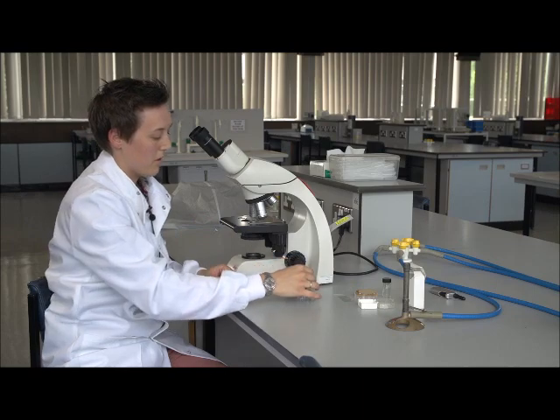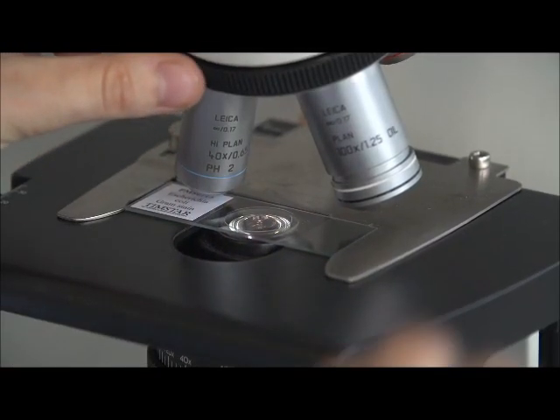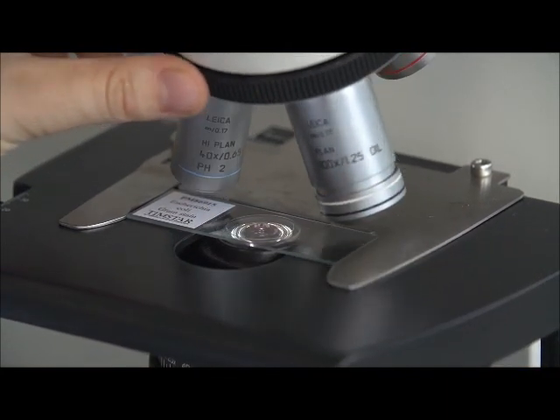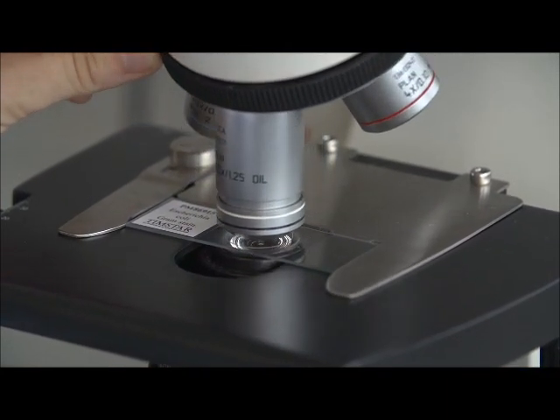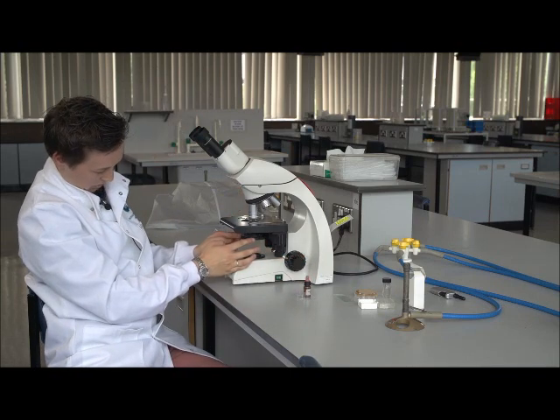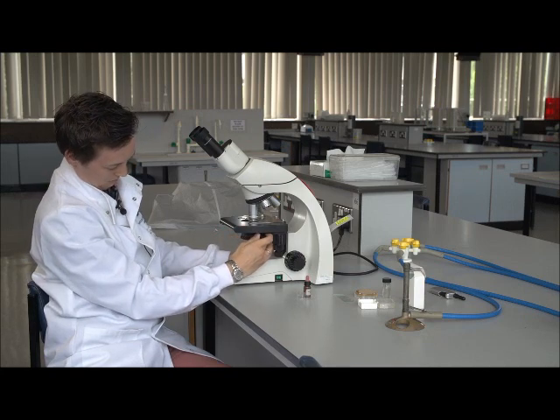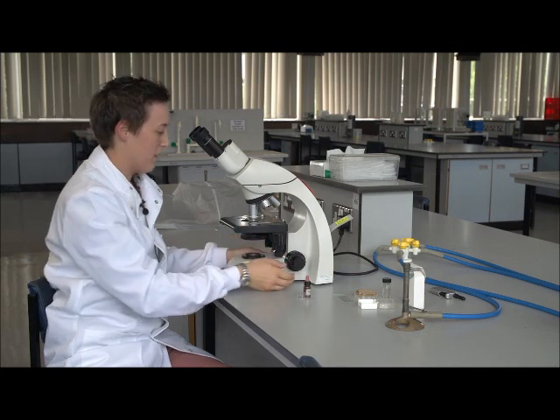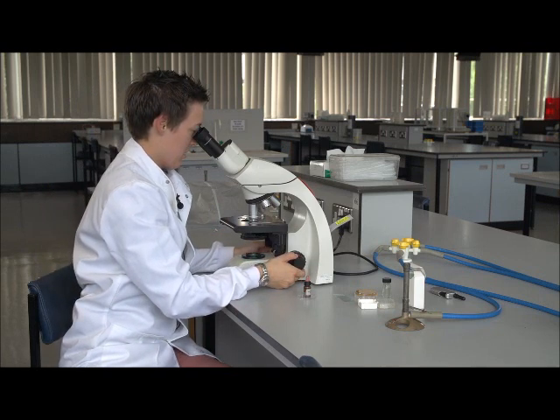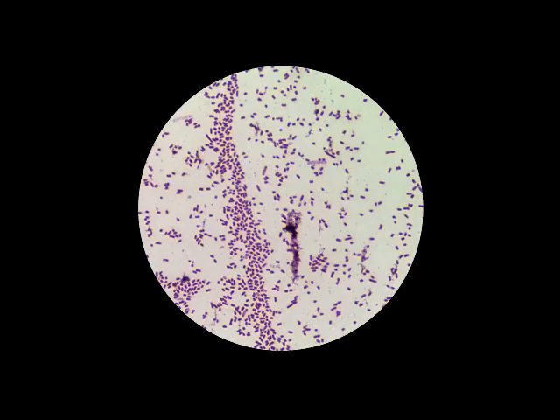And because we've focused it very well at 40 times, we can now swing the 100 times in and it will be touching the oil. Again, we may need to open the aperture slightly more. We can also now take out the phase ring because the 100 times lens is not a phase lens. A slight adjustment, and now we can see our nicely stained gram-negative E. coli.